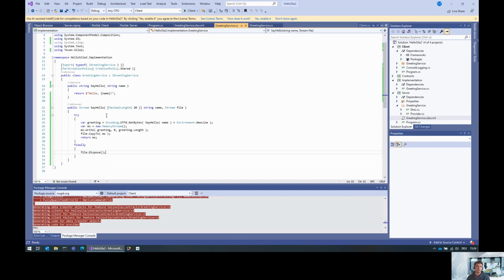One thing I forgot. What we did here is we calculated the greeting, added the greeting to the memory stream, and copied the input file to the memory stream. That means the position of the memory stream is actually at the end of the memory stream. So if we pass this memory stream as is to the SDK now, it's already at the end, so it will basically not write anything there. So we have to reset the position to 0 before we actually return this. Very important.